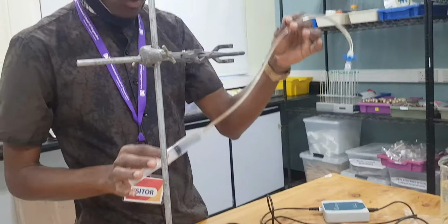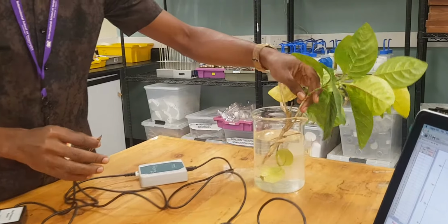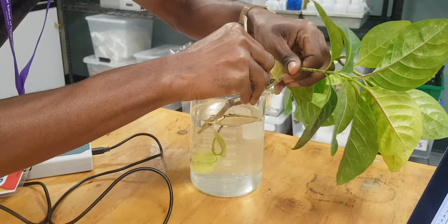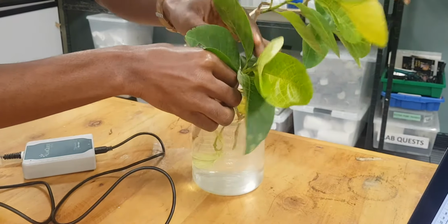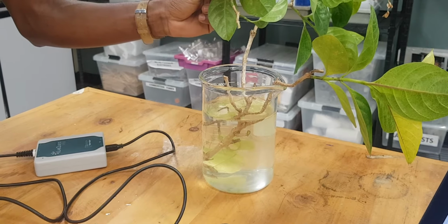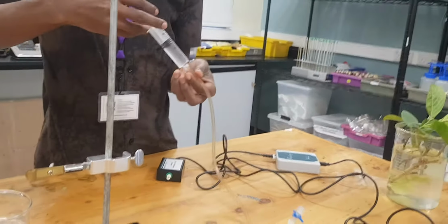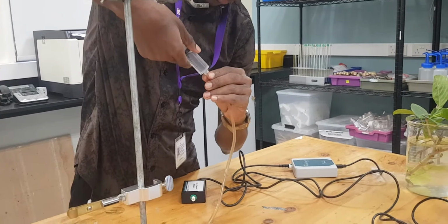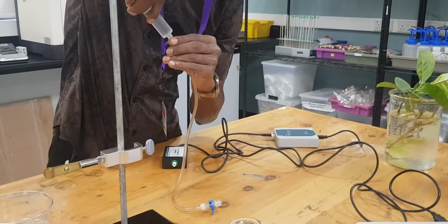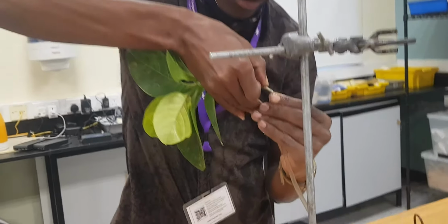We have already finished filling water, so now we are going to use the razor blade to do a fresh cut of this tree. We're going to cut very freshly here. We are going to use this fresh cut and place it in here once we remove our syringe, right? So we remove the syringe, then we put this one. Remember, when you put that, you should avoid bubbles. Use the right diameter so as to avoid air bubbles.